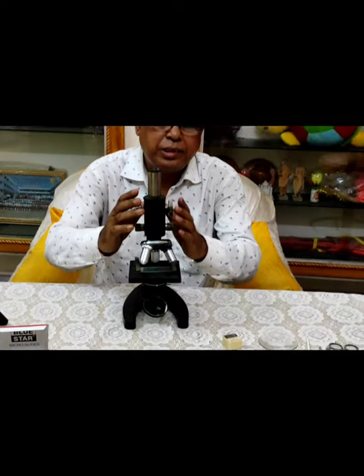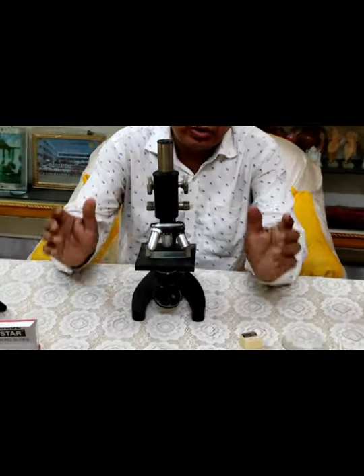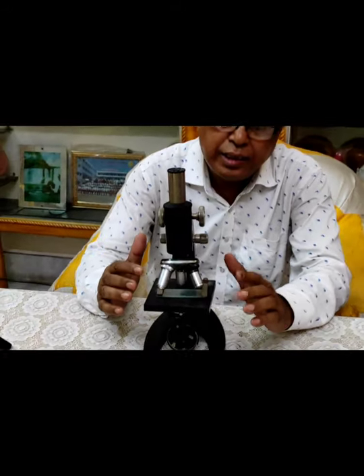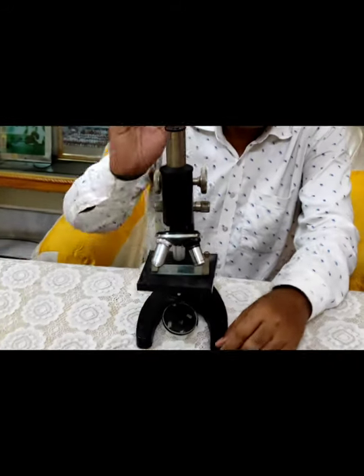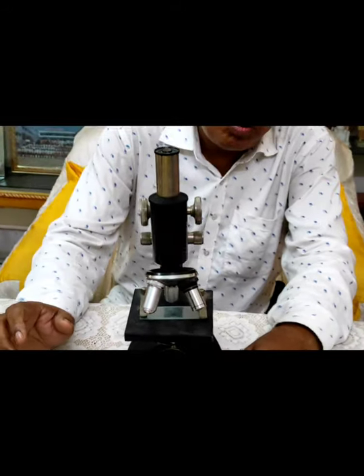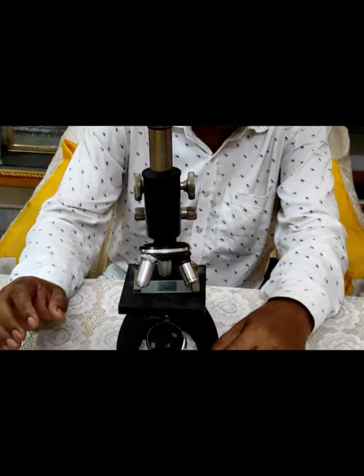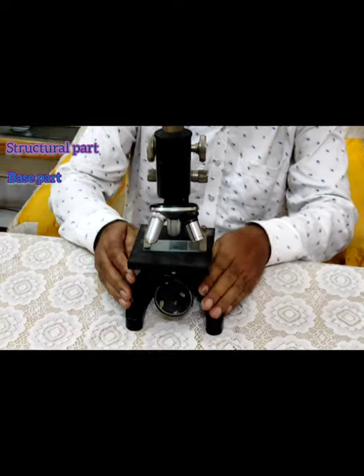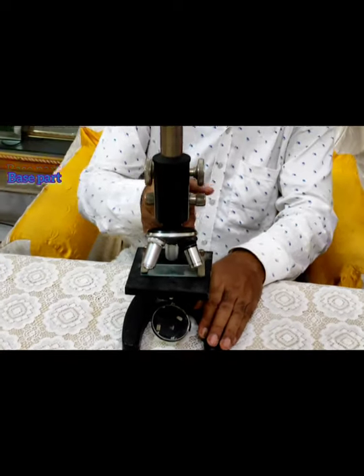Today I will discuss about the different parts of the compound microscope. And here you will see — this is a compound microscope. You can see these are the three parts of the compound microscope: the structural part, the base part, and the arm.